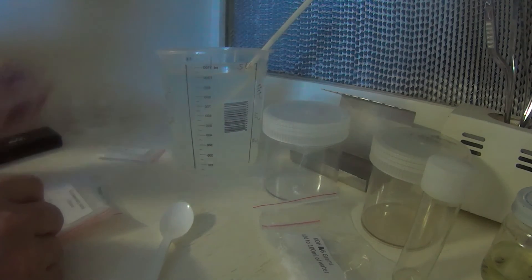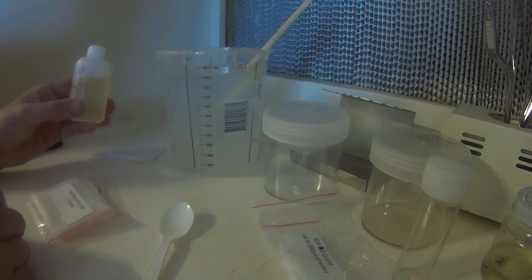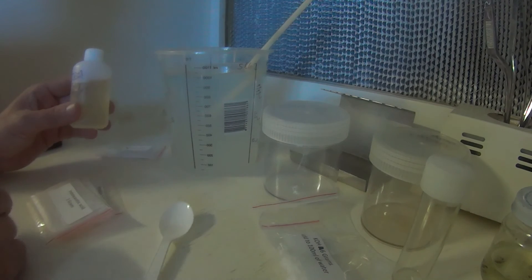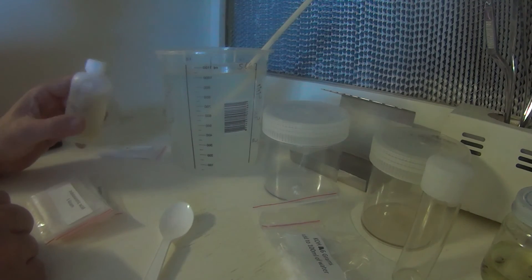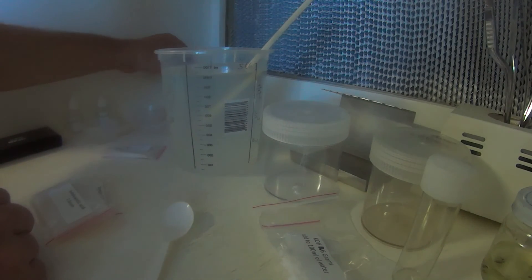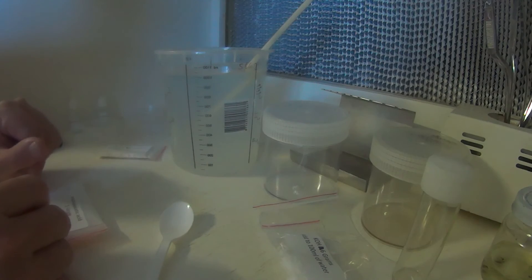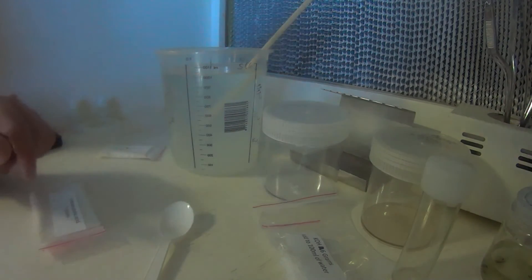So at this point, if I wanted to make a rooting hormone, I'd simply take out the required amount of IBA that I've already mixed up into solution here. So, this is one milligram per milliliter. So, if I need one milligram of IBA in that solution, it's just a simple matter of taking one ml of this solution and adding to that. So, one milligram of IBA, or whatever plant growth regulator you're using, to one liter. So, there is instructions on how to do this, but it's, like I said, it's pretty straightforward. If you need two milligrams of your regulator in there, once again, two mils of the solution, add and stir.